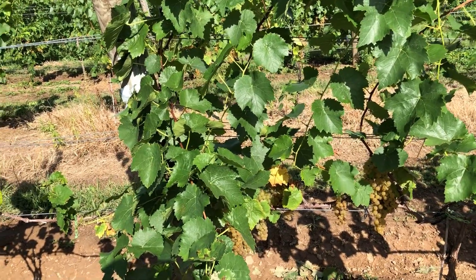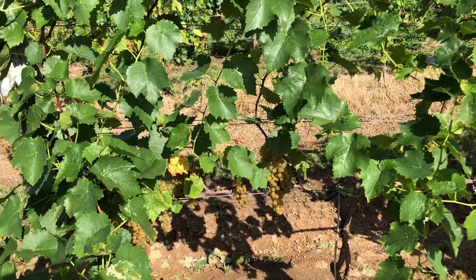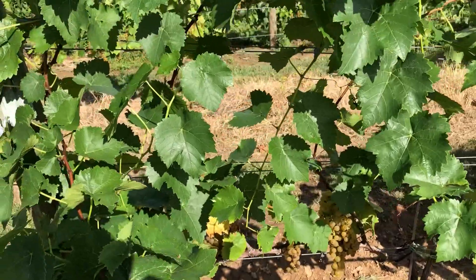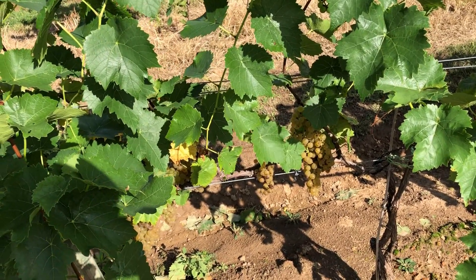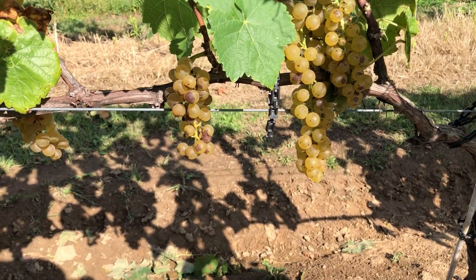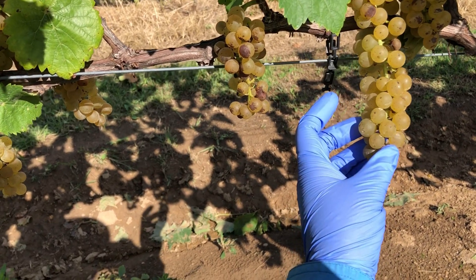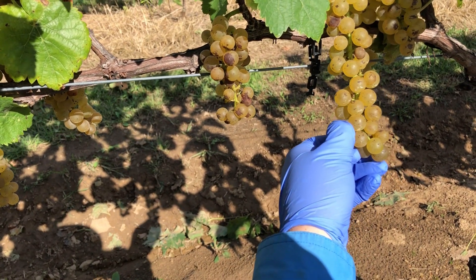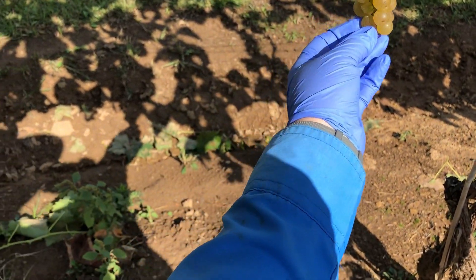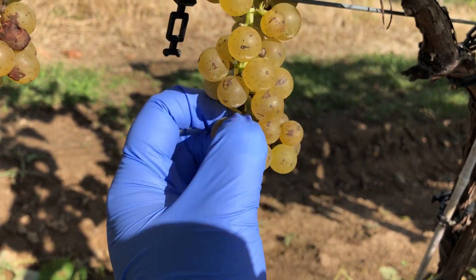The owners of this vineyard want all the grapes to be tested so that we can have a good idea — if we go through and harvest everything, what is the sweetness of that juice going to look like? If you're only going to harvest fruit that's super sweet, then you only need to test the super sweet fruit. So I'm going to take things of varying sizes and varying ripeness, and we're going to take about 50 to 60 grapes as a sample.